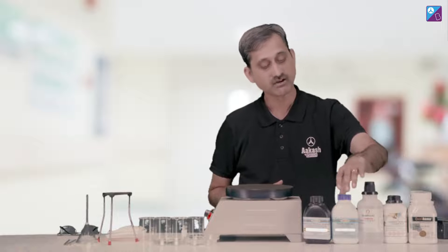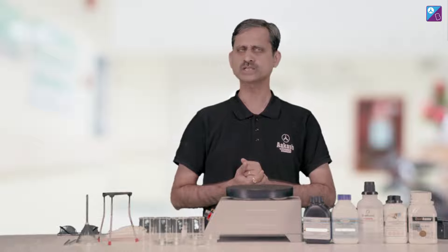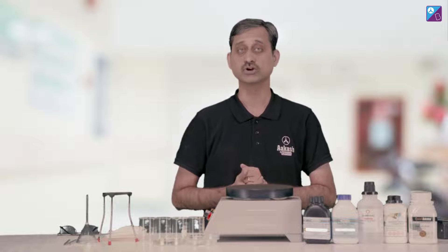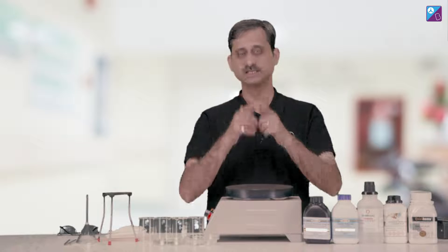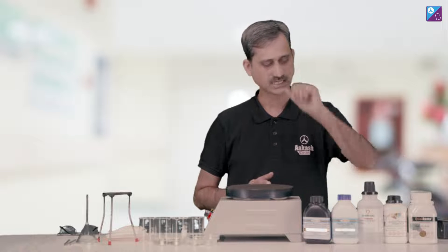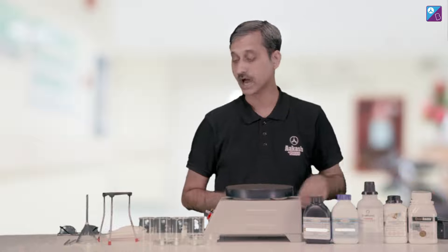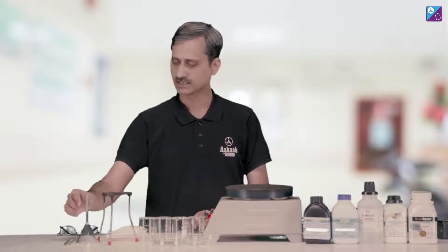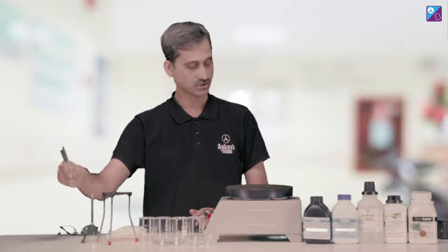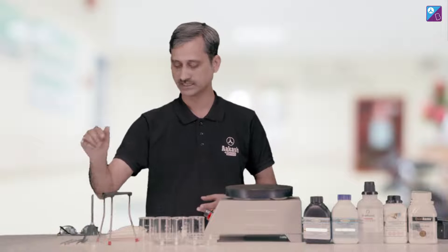So we have ferrous ammonium sulfate, copper sulfate, sulfuric acid, and here we have distilled water. If we talk about the apparatus, we have the funnel, which is necessary for filtration. This is our glass rod, which we need for dissolution and for transferring.